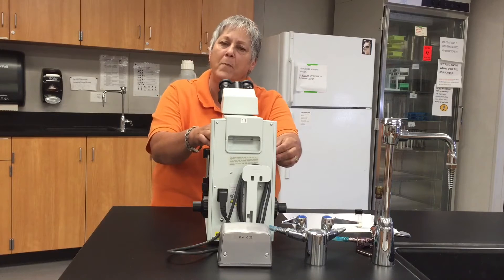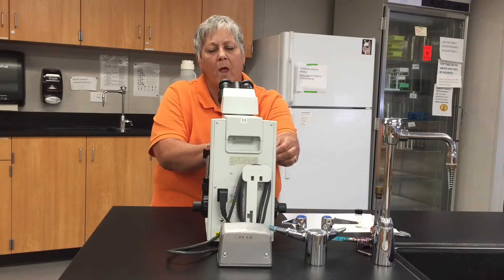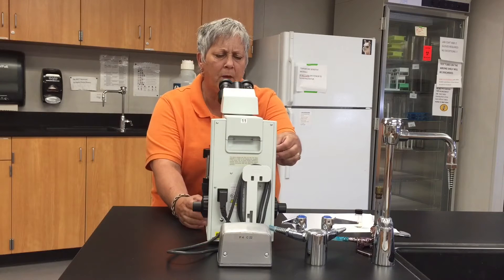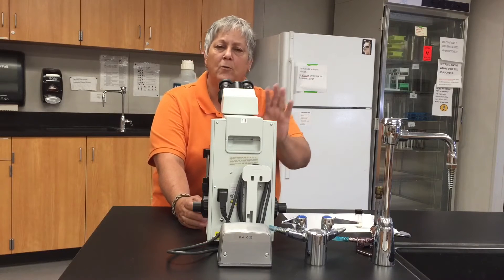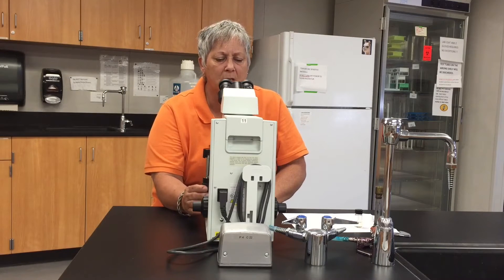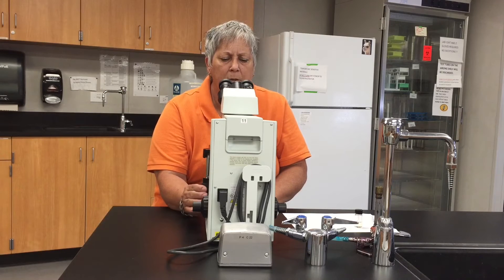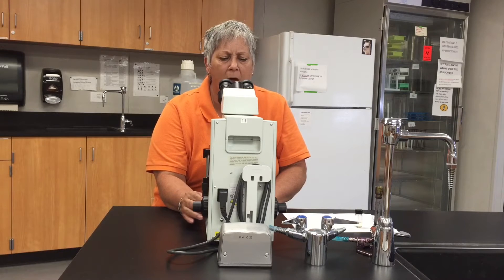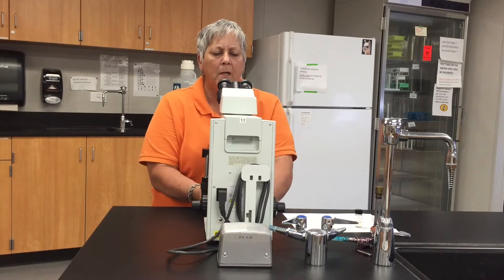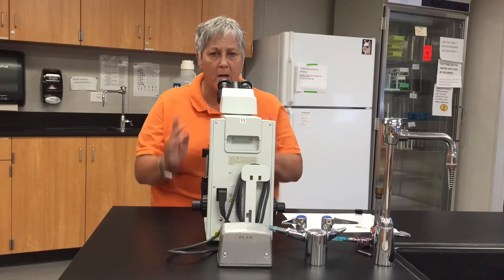I open my slide clip, slide the specimen in there, and gently release the slide clip, positioning the slide so that one of those smears is right underneath the objective lens.